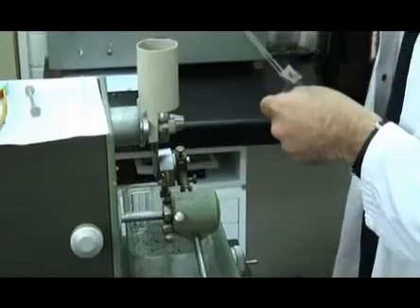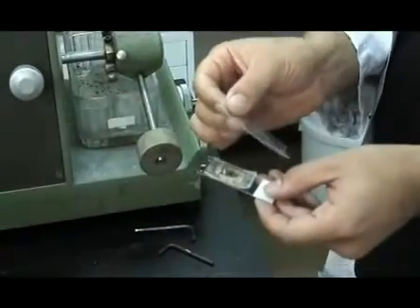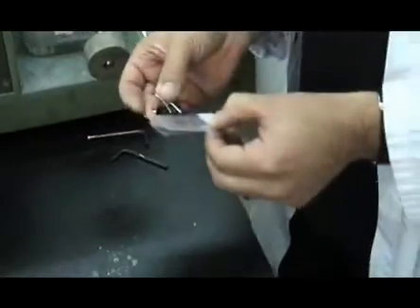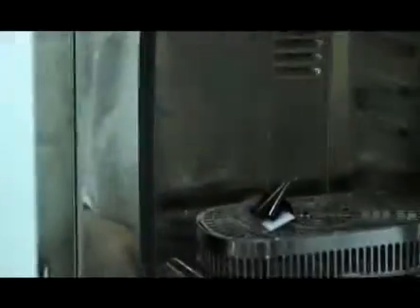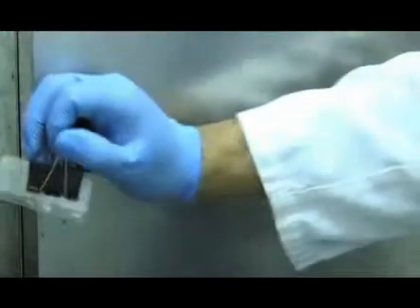When the section is ground it is then placed on a slide. It may be cleaned and polished as required. The section has a tendency to curl, so we recommend placing a portion of a sandwich bag over it and holding it flat with another slide clamped into place. It is then placed into an incubator of between 60 to 80 degrees Celsius for one hour. This softens the methacrylate and helps the section adhere to the slide in a flat manner. Here we see a composite fluorescent image of three different fluorochromes injected at monthly intervals, enabling identification of the site of mineralisation at a distinct time point. The doses and preparation of these labels can be found in the text.